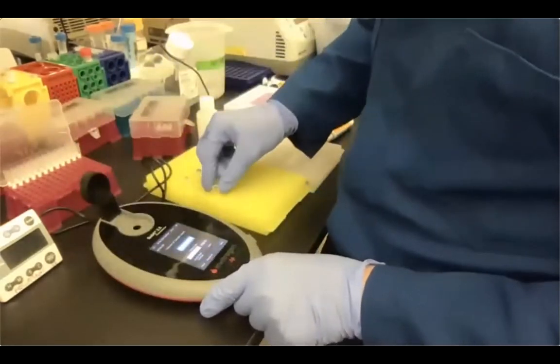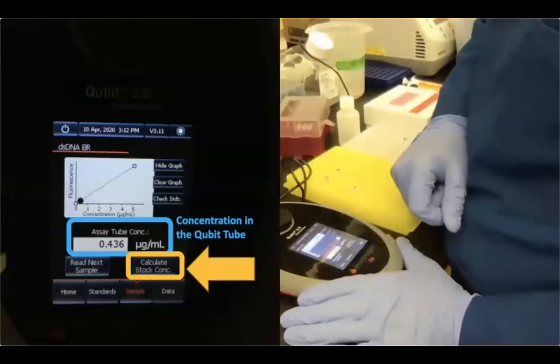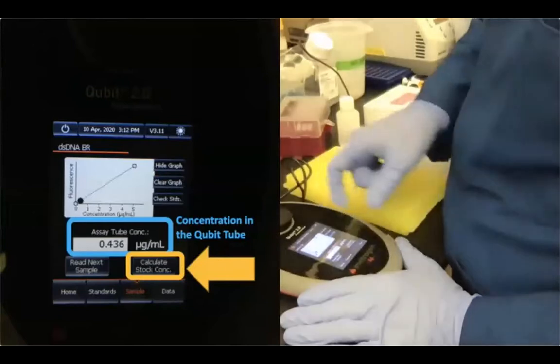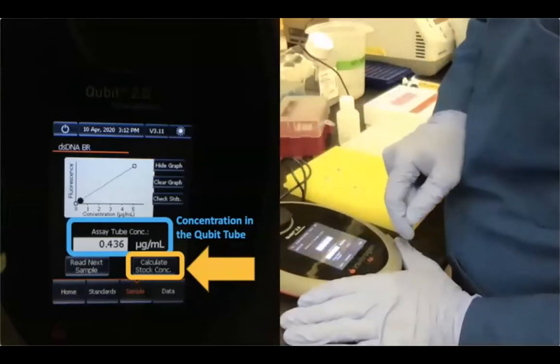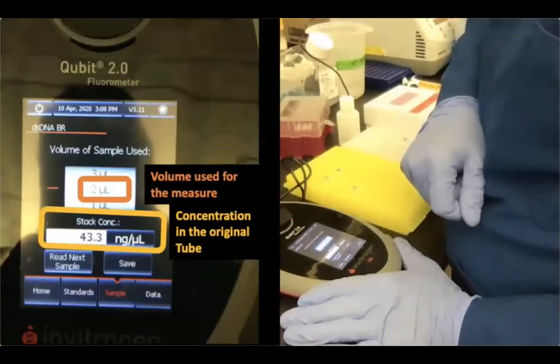And then I'm going to measure sample B. I'm going to read next sample. And it says that the concentration, once I calculate the stock, is 43.3 nanograms per microliter, okay? So this is our final concentration measured with the Qubit.